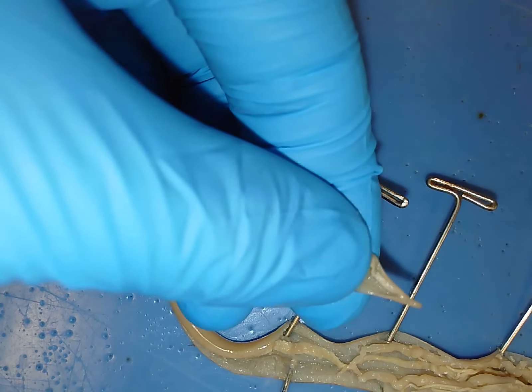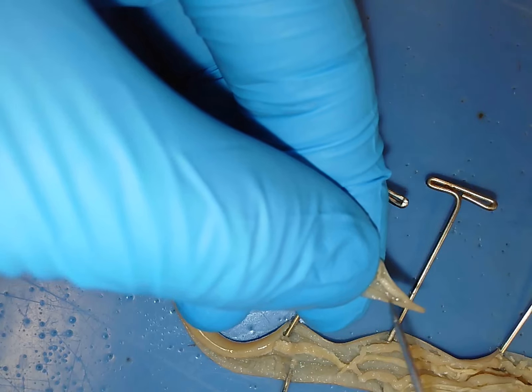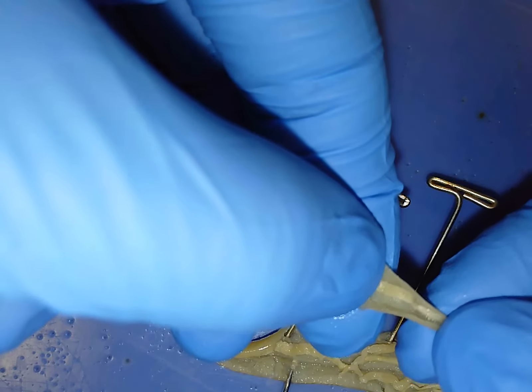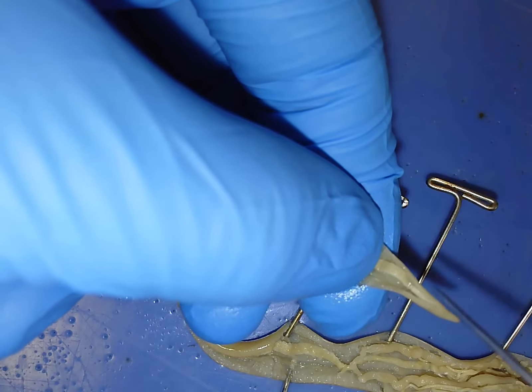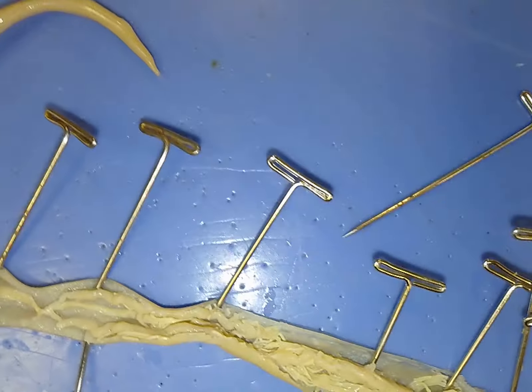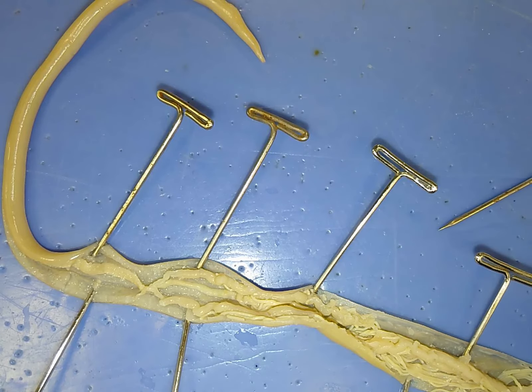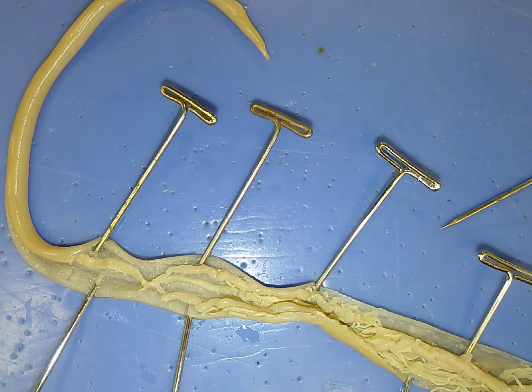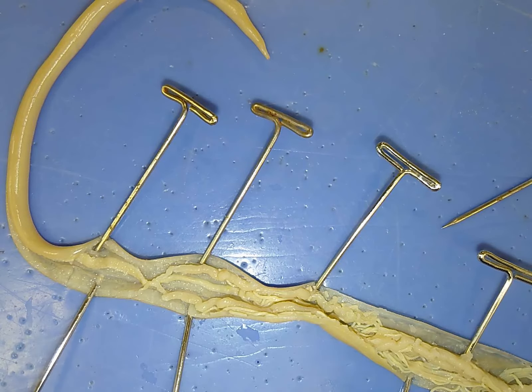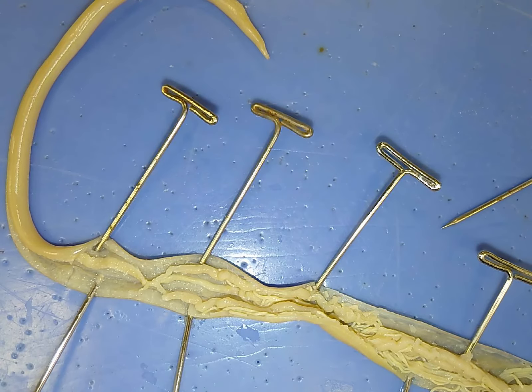If I tease open the cuticle all the way up to the mouth, we might be able to see the pharynx. The pharynx and the intestine look basically identical — there's not much that distinguishes the two structures in terms of appearance. But the pharynx acts as a muscular organ that pumps food into the rest of the intestine. This here is the pharynx — you can see a slight difference between this pharynx and the intestine just behind it. These organisms don't have a very complex digestive system because they are parasitic; they're absorbing all their nutrients from a host. A complex digestive system would put them at a disadvantage, using a lot of energy to maintain it when they don't need one, so these parasitic organisms have a very simple digestive system.